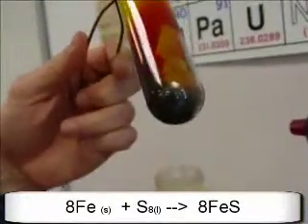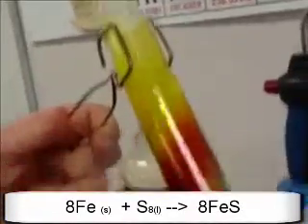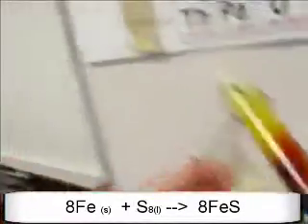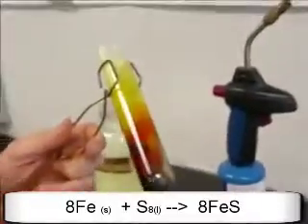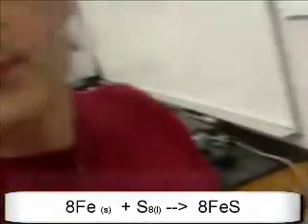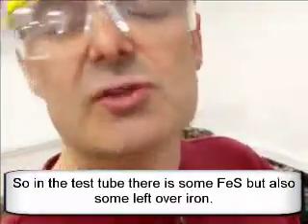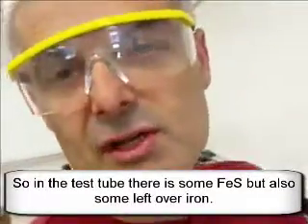If I take the magnet, now that the iron has reacted, it is no longer going to be attracted to the magnet. As you can see, there's some that's attracted to the magnet. I probably didn't put enough sulfur in the reaction, but if I were to truly cause this to totally react, it would not be attracted to the magnet at all, because I think I put too much iron in there. You'd have to figure out how much you'd want to add to it. But let's assume that I did. It would be unattracted to the magnet, which means you have produced something else, in this case iron sulfide, as opposed to just iron and sulfur.